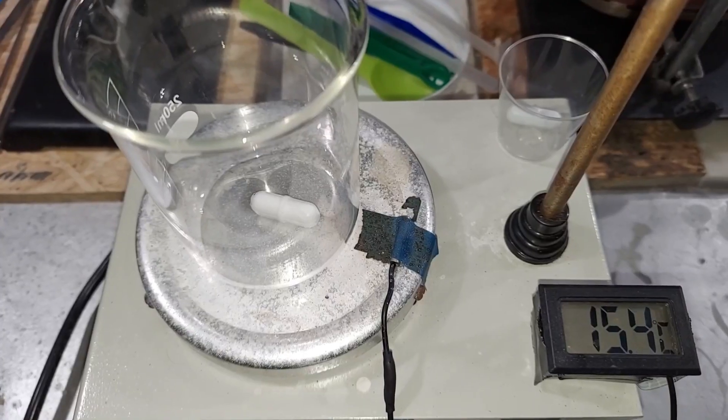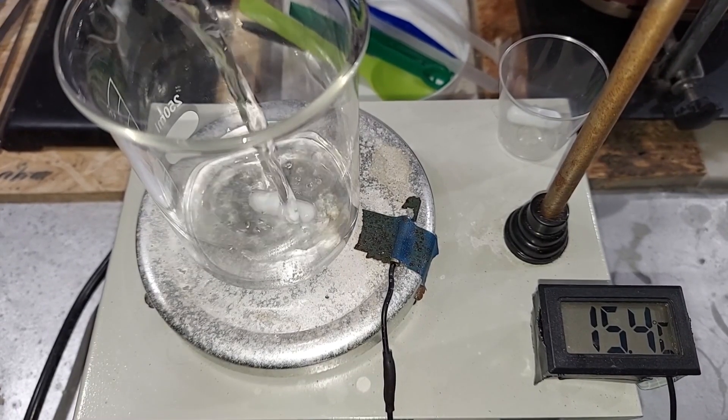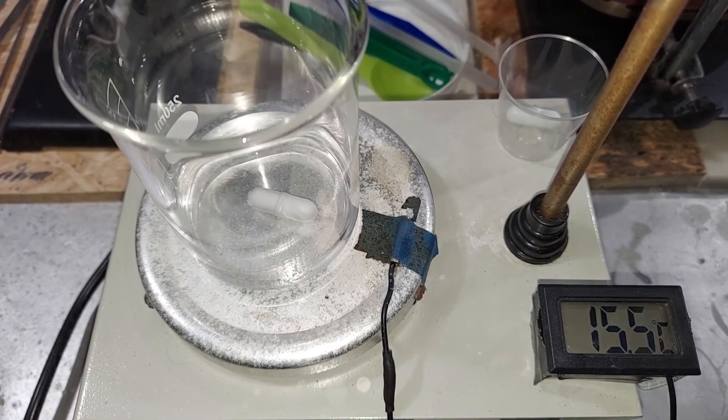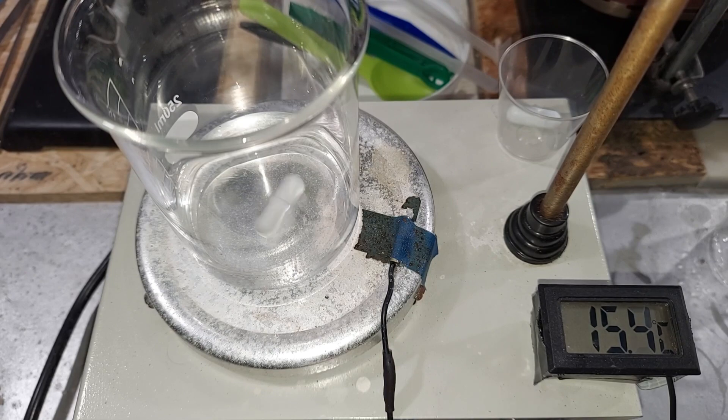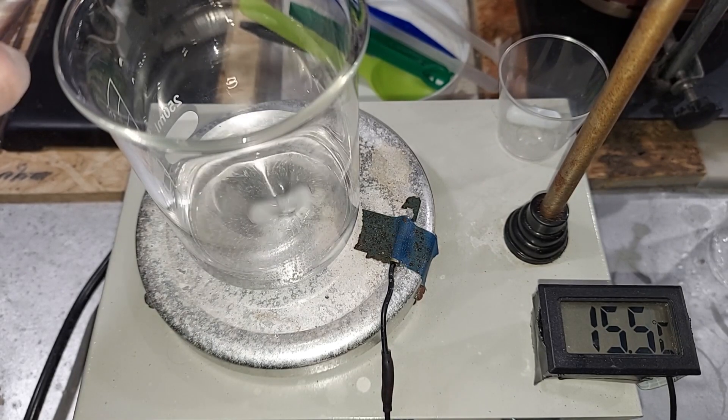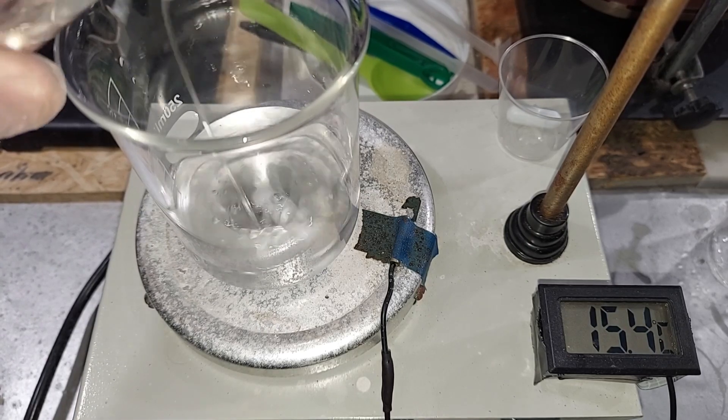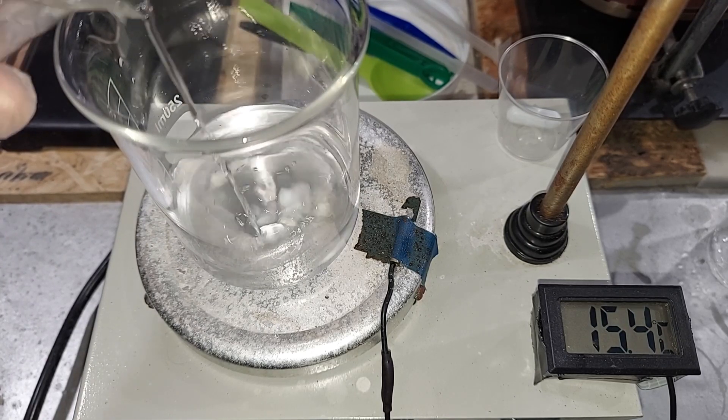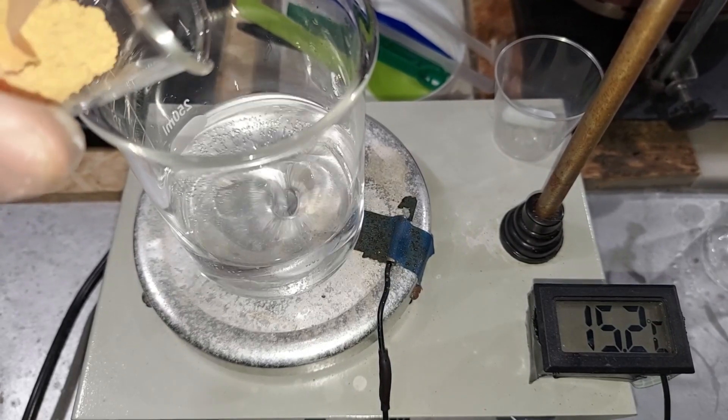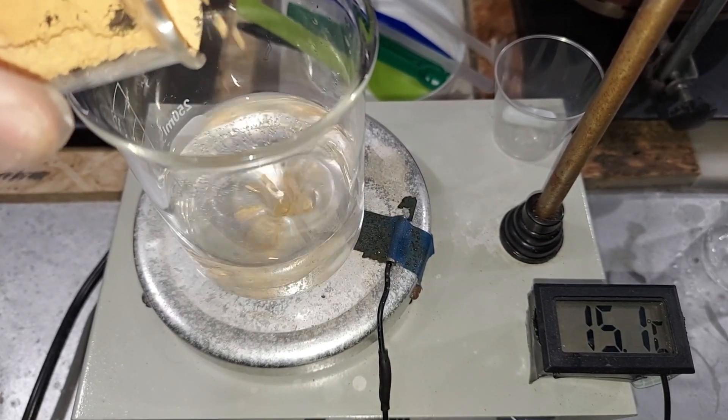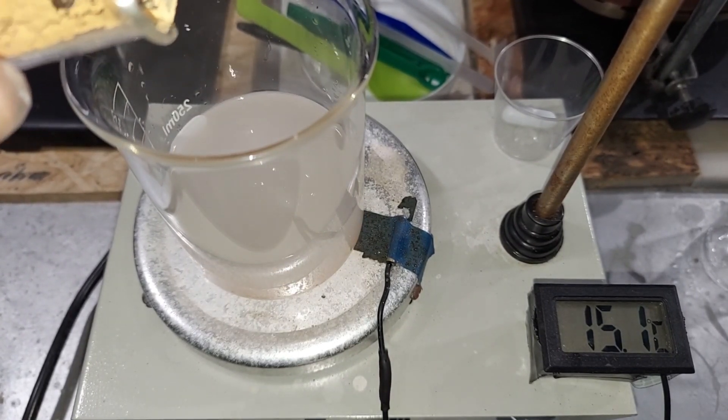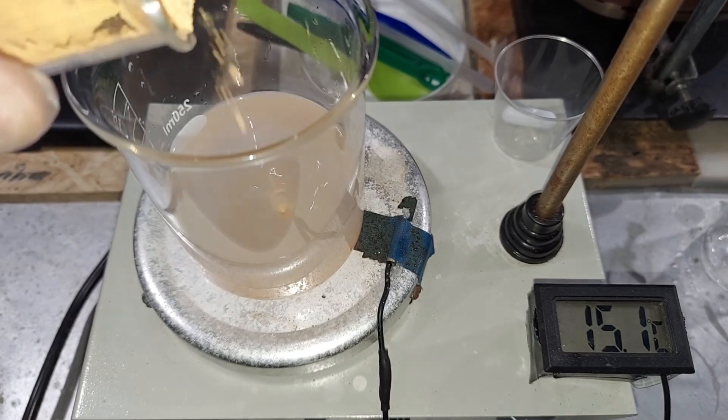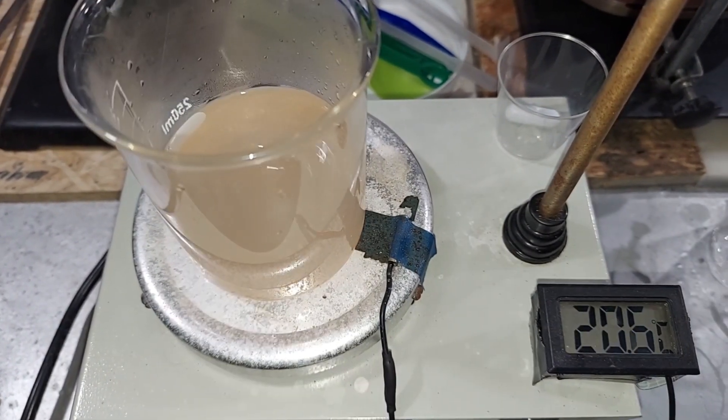Making our 50% acetic acid solution, I'm pouring the water in first and I'll slowly be pouring in the acetic acid while this is gently turning here. Adding the lead oxide will cause it to heat up a bit. You don't need any additional heat in any of this process. Right here all the lead oxide has been added, it's almost all dissolved.